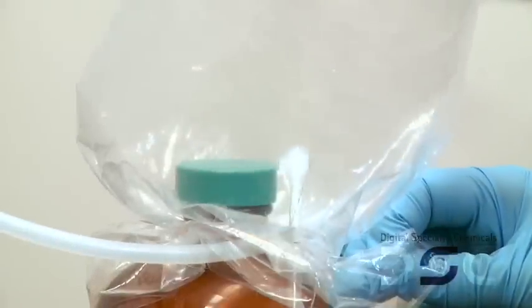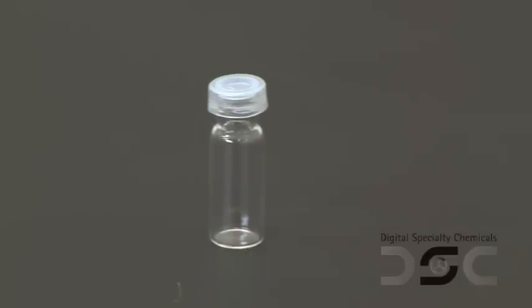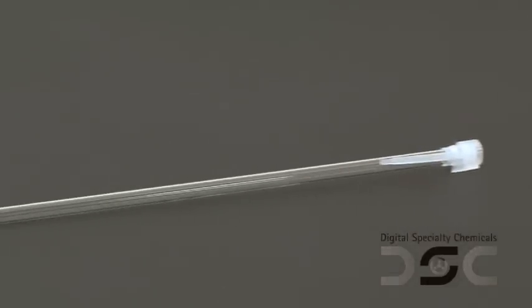A simple elastic band, and finally the sampling vessel for the chosen analytical method — typically a vial for GC and HPLC, or a tube for NMR.